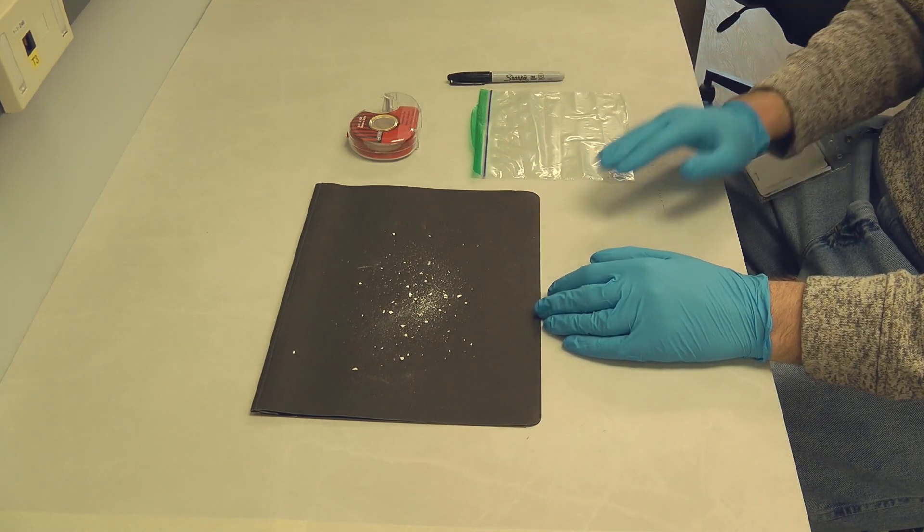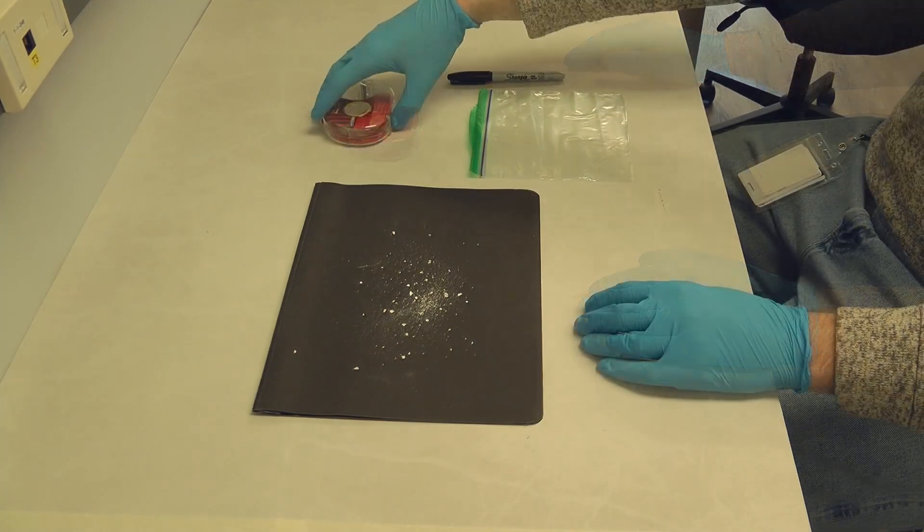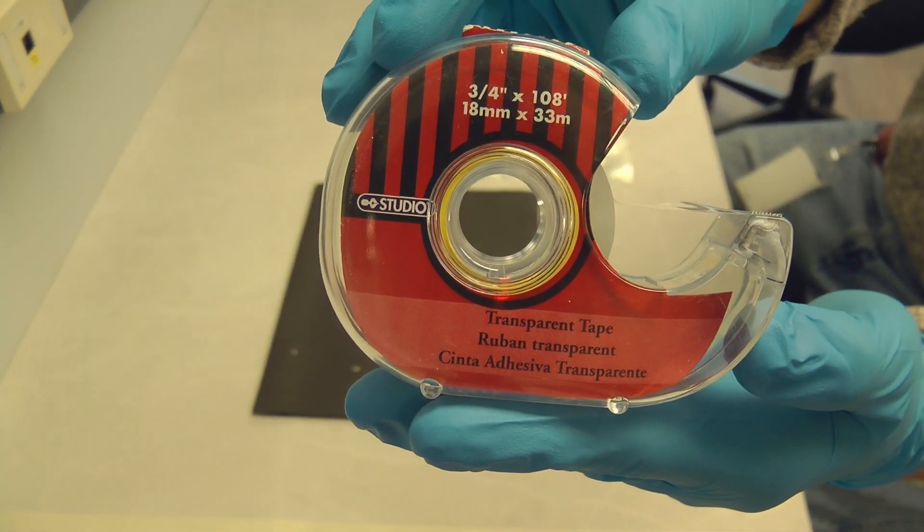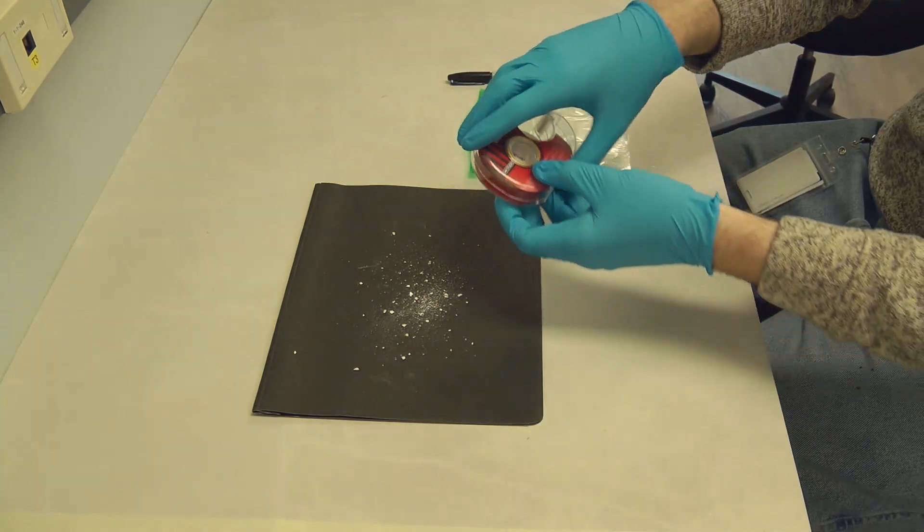The technique is very simple and all we need are a clean ziplock bag, transparent tape, and a marker to label your samples. Please use a transparent tape which has the word transparent written on the dispenser.